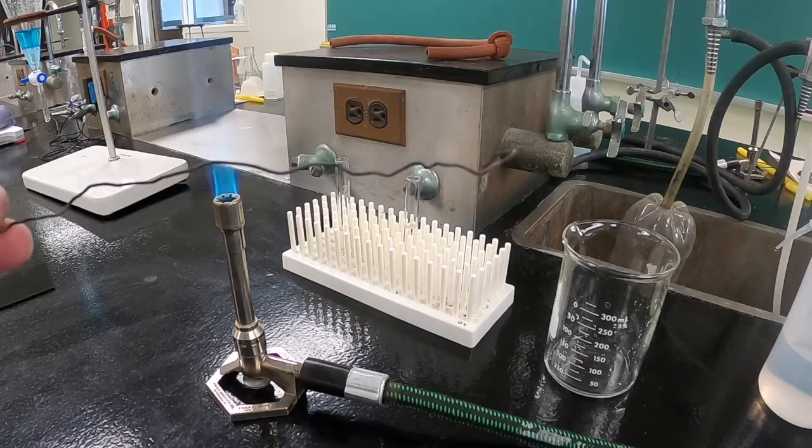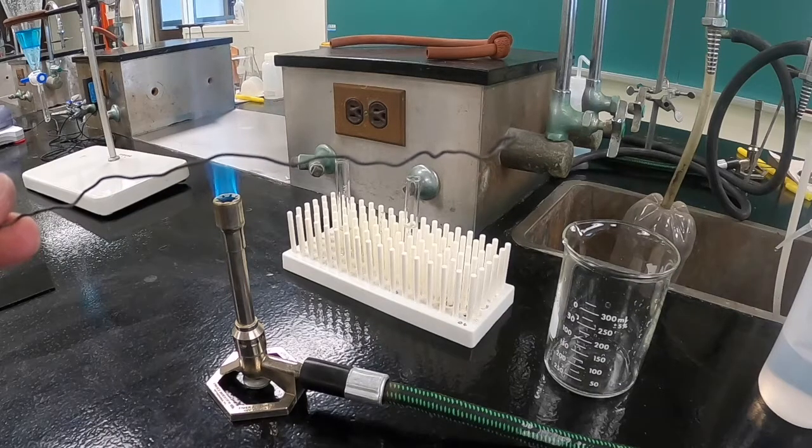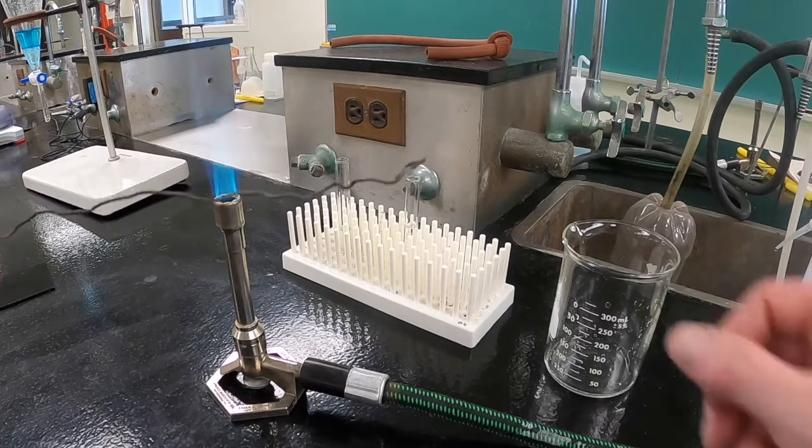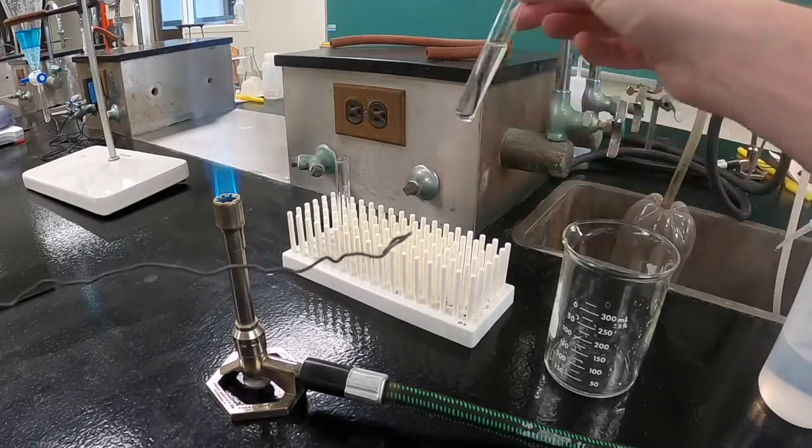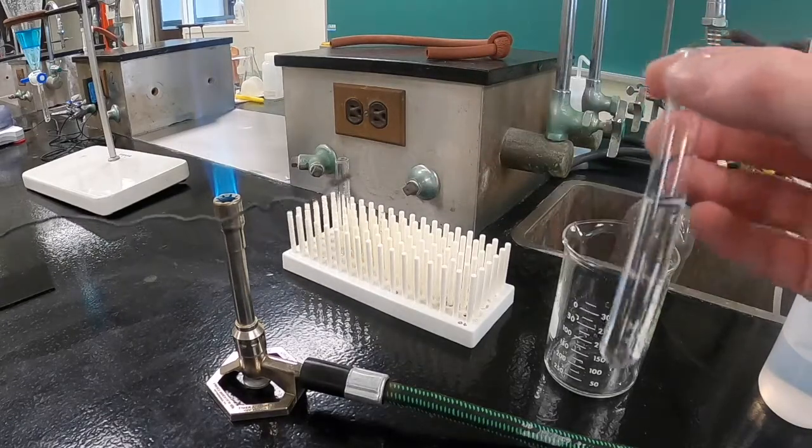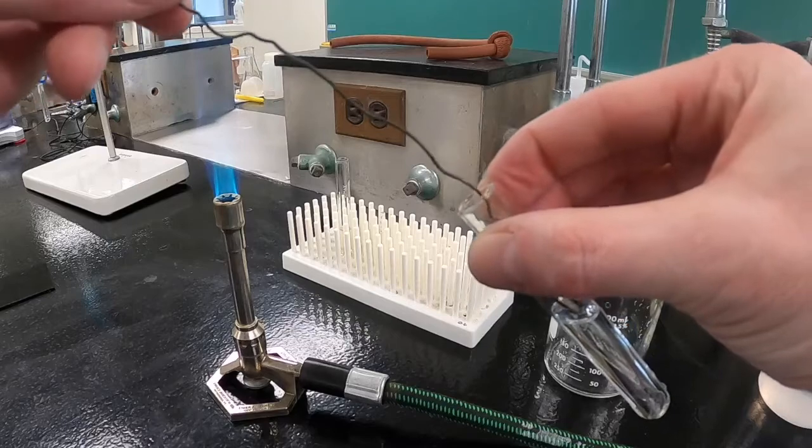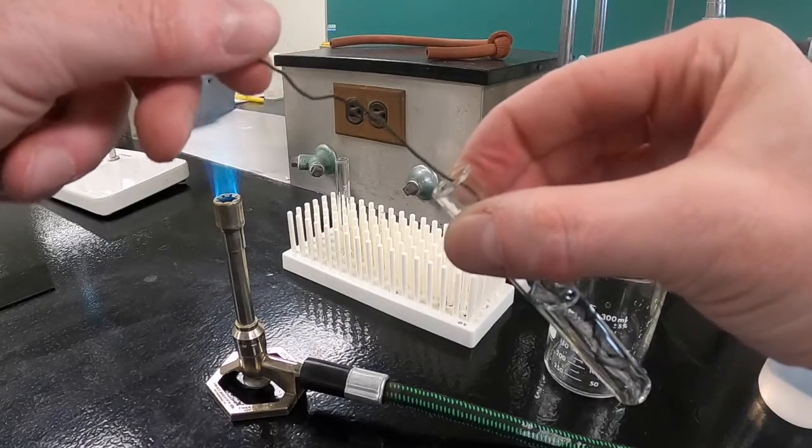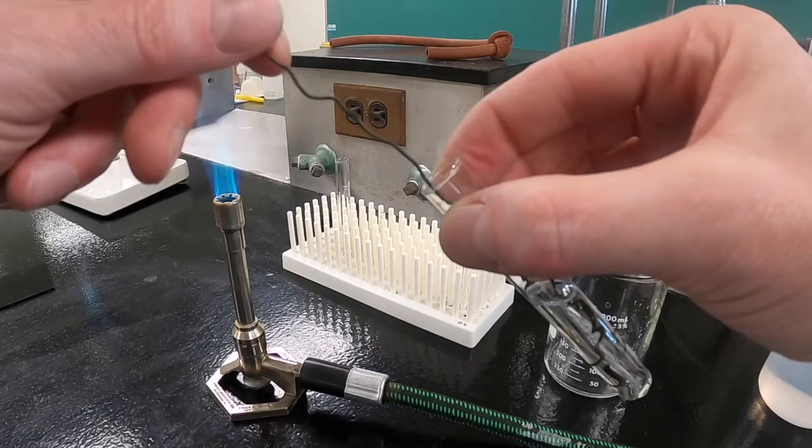Once the wire is cooled, you should dip it into the sample you want to test and make sure that a visible droplet of the solution is adhering to the tip of the wire. And that sizzling sound means that I didn't wait long enough for the wire to cool.